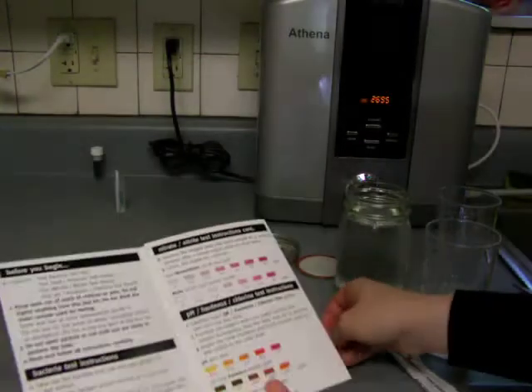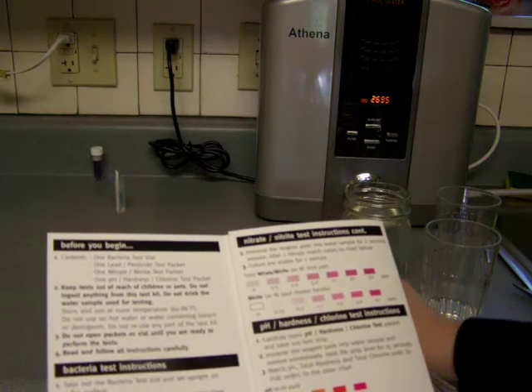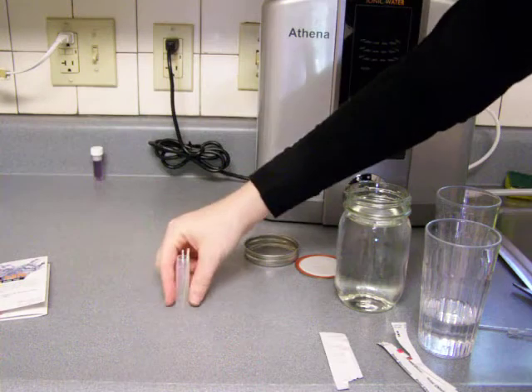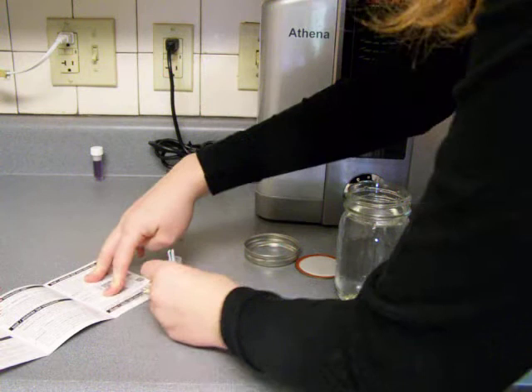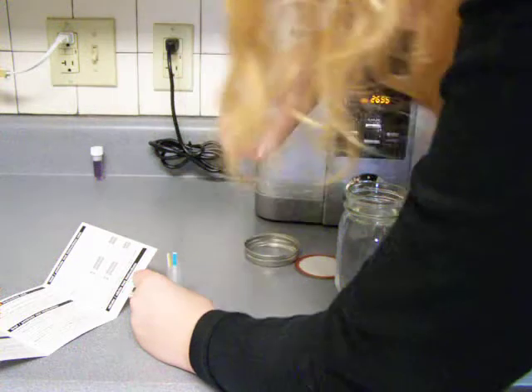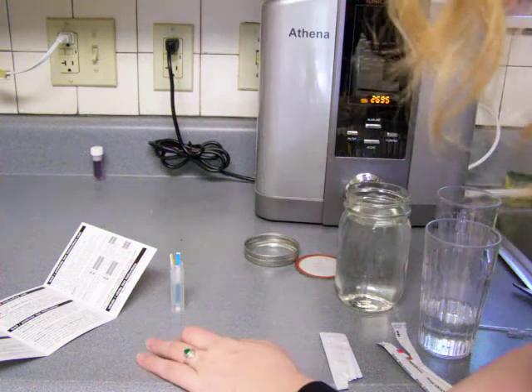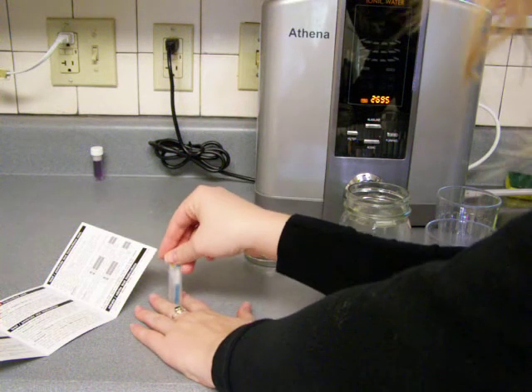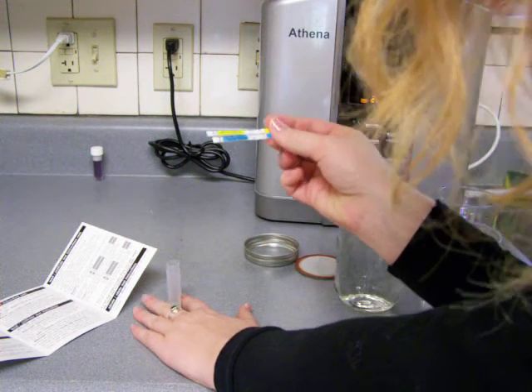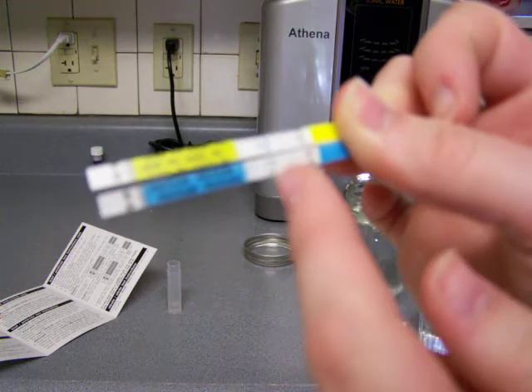Okay. Good. And. Okay. So this one. How long was I supposed to let this sit? 10 minutes. Okay. Okay. Looks like there's little lines showing up there. And it looks like both of them are towards the one. For the sake of having a shorter video, or not more than one video, I'm going to just take these out. And see.